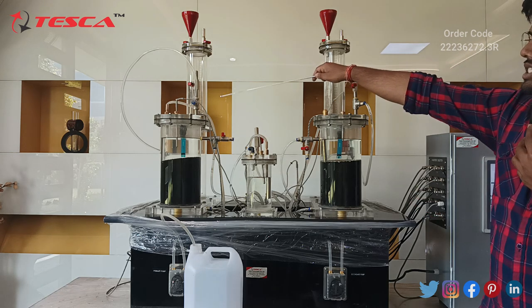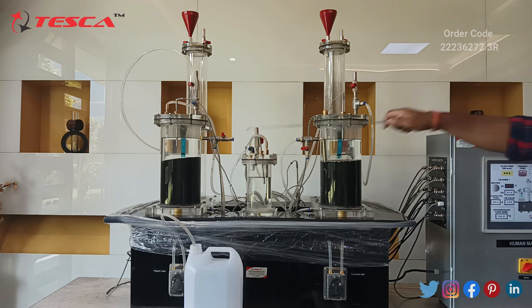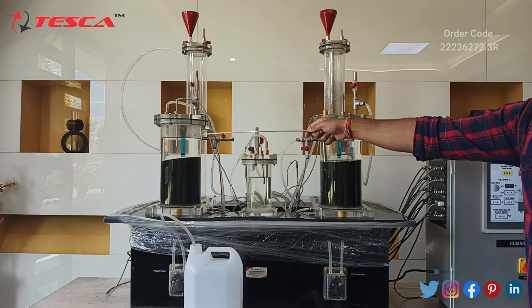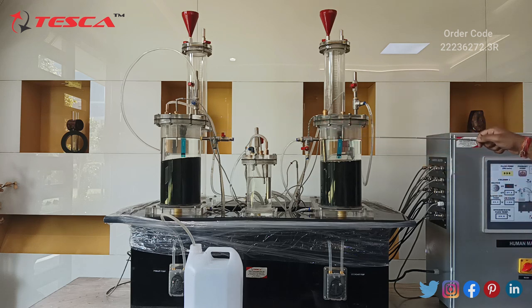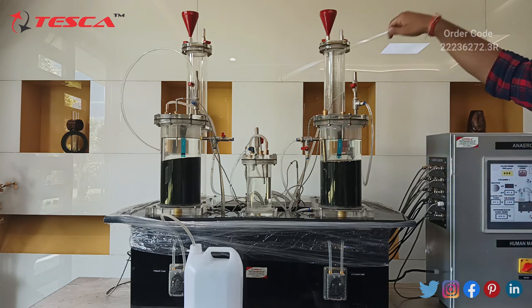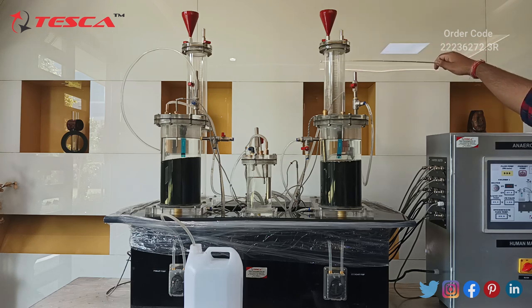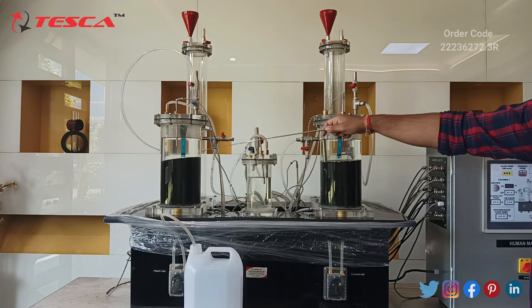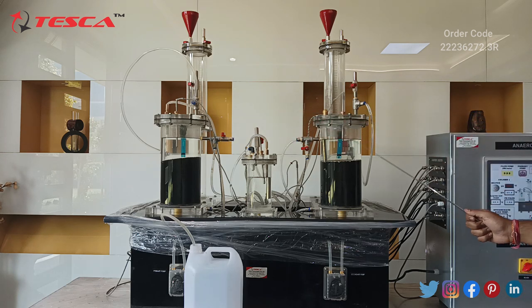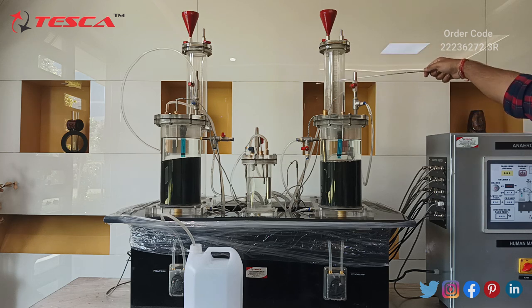After that, we will fill our gas tank 1 and gas tank 2 with water, so that when we heat column 1 and column 2, the gas generated moves into the gas collecting tanks and the volume can be measured. Now let us turn on the heater so that gas starts generating in column 1 and column 2 while we are filling the gas tanks with water.